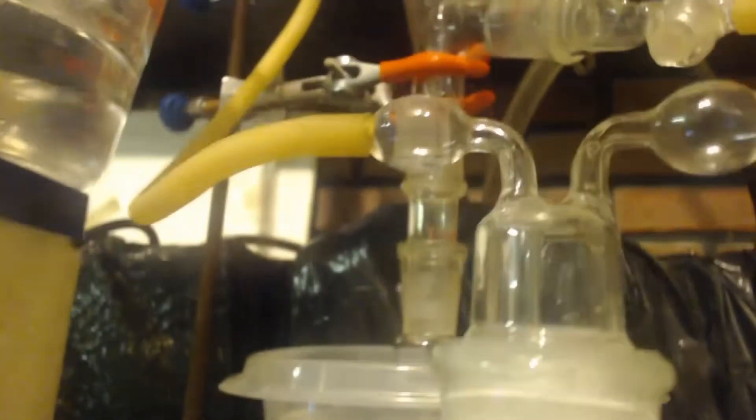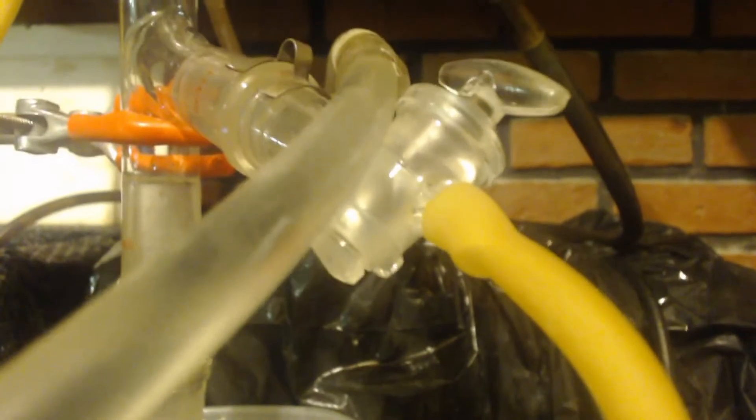You might even put water in there. There are no gases getting past the cap. If there are gases, I slow it down. I have the boil at the lowest simmer possible, because otherwise it makes it past the first condenser and past the bubbler and starts filling up the head. The constriction from the valve keeps the gases in there so they have time to dissolve into the ethanol — the 80 proof vodka.